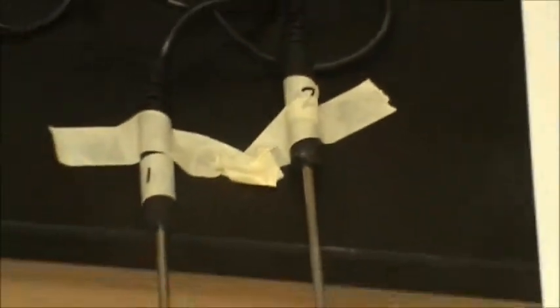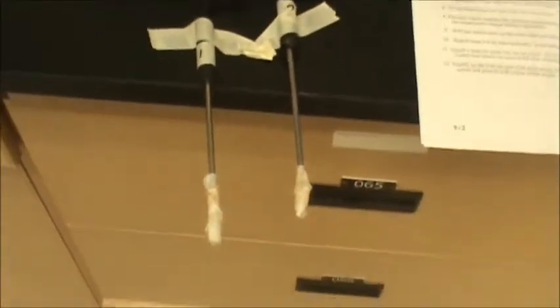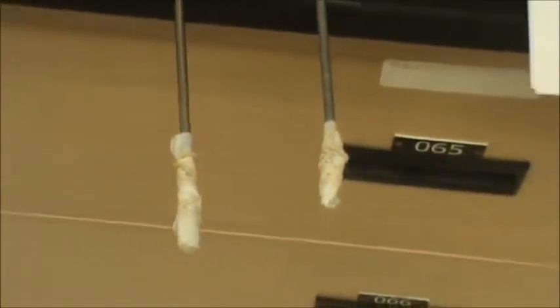So as you can see, I've gone through the 15 seconds to kind of set the temperature. You can start to see the temperatures are starting to drop. The reason why it's dropping is because now I have the temperature probes outside of the test tubes, and you can see them right about there. Can I zoom out a bit? All right, so you can see temperature probe number 1 and temperature probe number 2 are now in the air and are letting it evaporate. As I continue on, the temperature is going to drop, and it's continuing to drop.